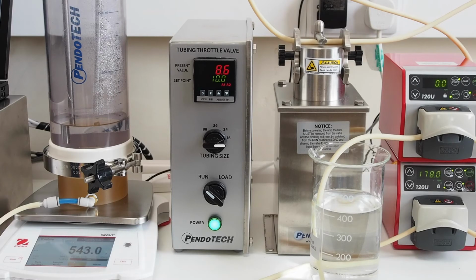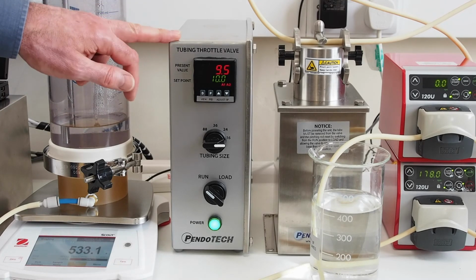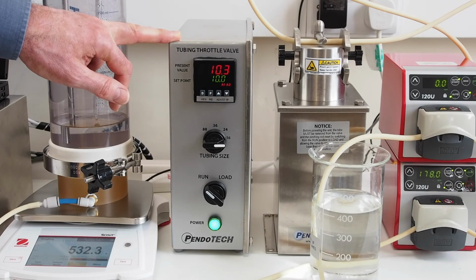If you have the pump rate set too fast, you can overshoot, so it's best to have a slow build up till we get to the set point, which we're just about to hit. And although you can't see the valve operating, it's squeezing and releasing to increase and decrease the pressure. This valve will now stay in operation until the end of our run.